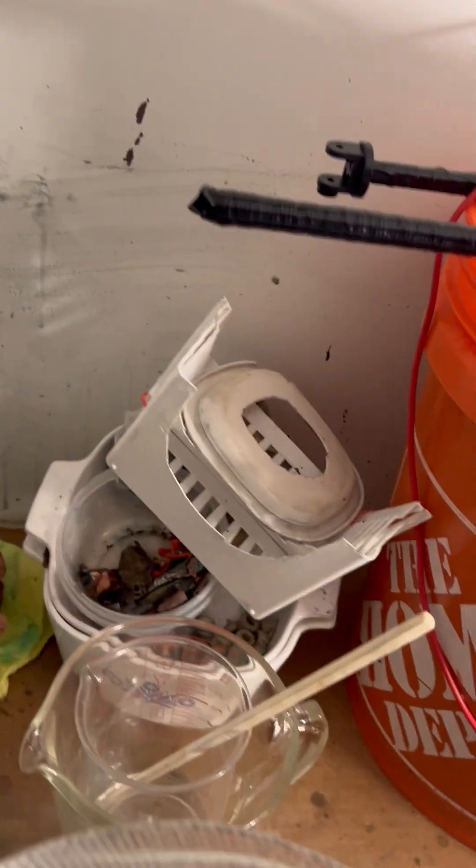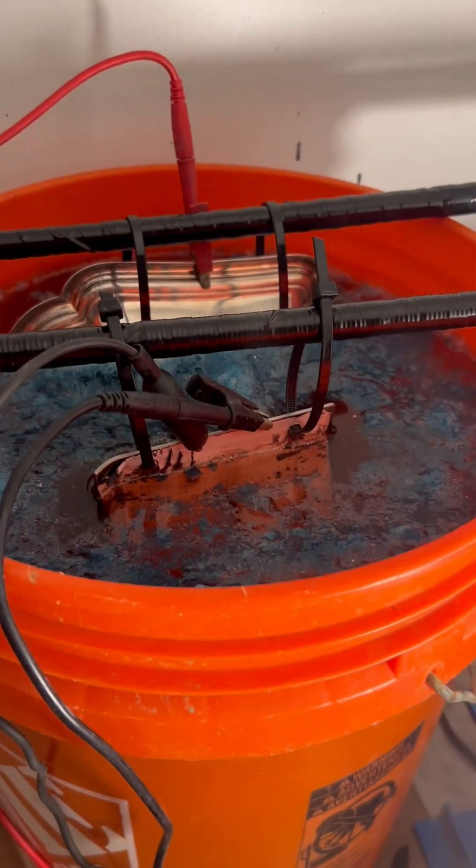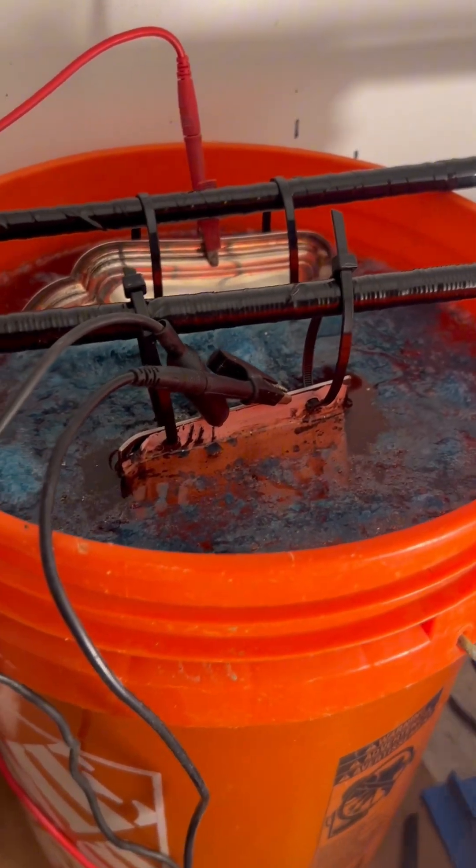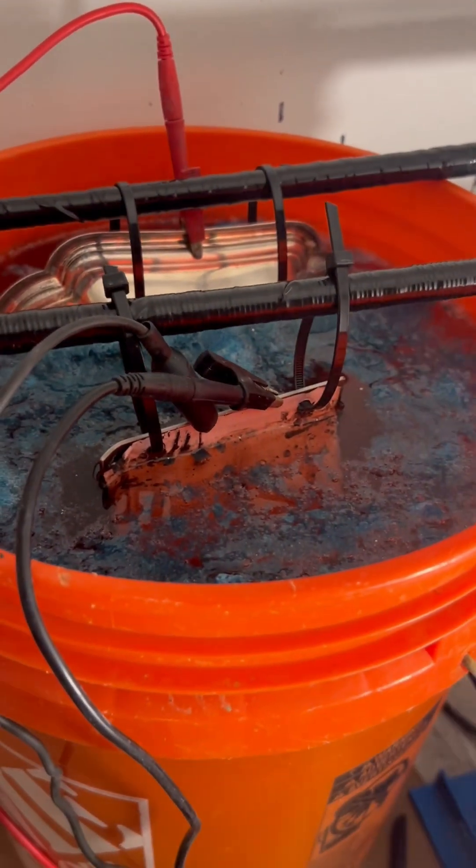I'm not gonna mess with that, and I want to give you a quick shot of that water cell. You can see some copper hydroxides, and we'll pull that out tomorrow, next couple of days, and look at it, and just see.